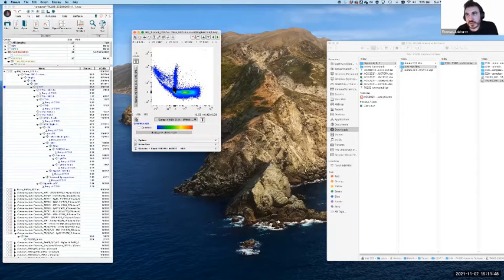This example is reasonably straightforward. It's a bit of a diagnostic process to say, okay, something is happening here and it looks like it is on cells expressing CD3. That gives us a clue as to what might be happening. The worst that happens here is, let's say you had a sample that only had CD4 T cells, and it's leaning over in both CD4 and CD3. You don't necessarily know which is the correct one. Is it CD4 that's overcompensated or is it CD3 that's overcompensated?